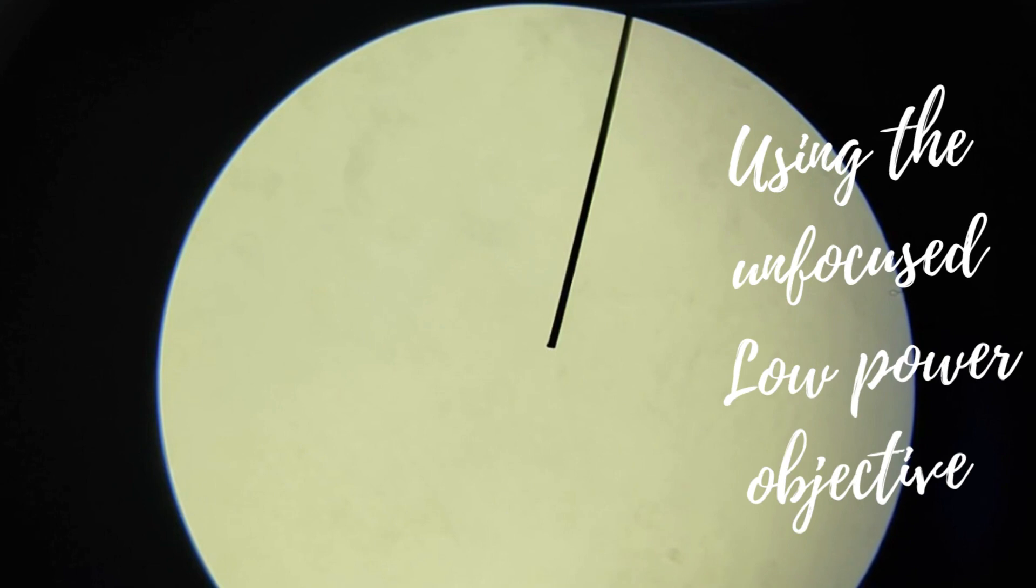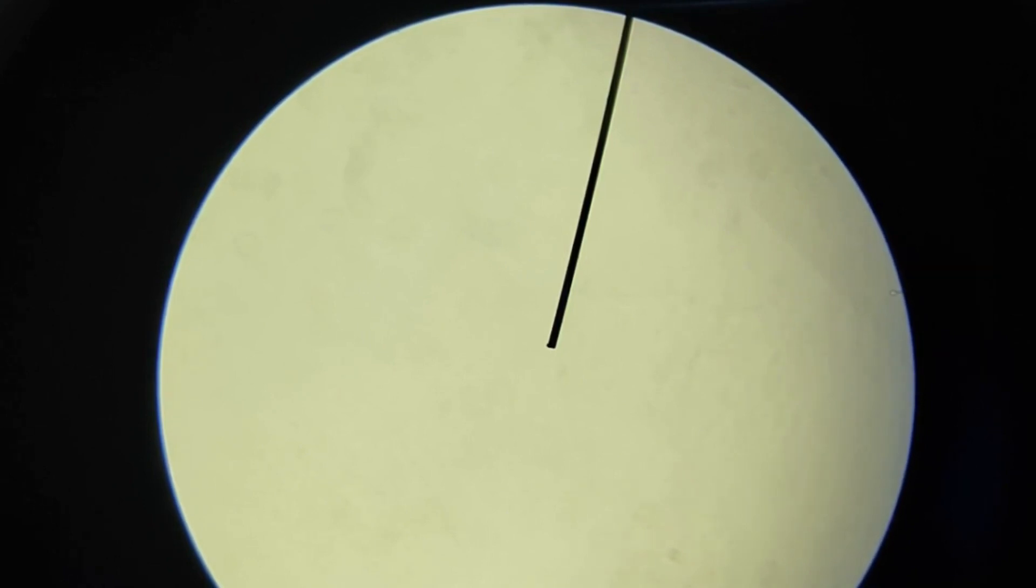The slide is actually on the stage and I am using the low power objective. I'm going to show you what it looks like when focusing with the low power objective.